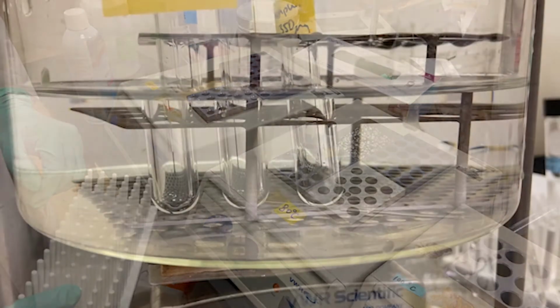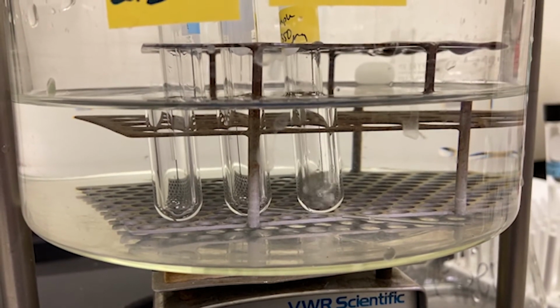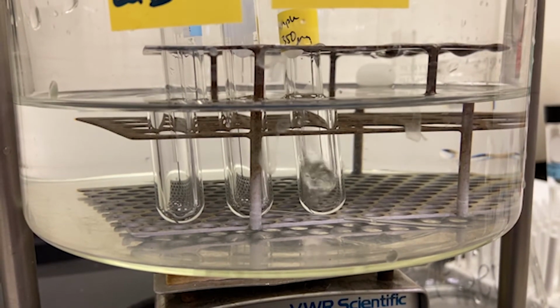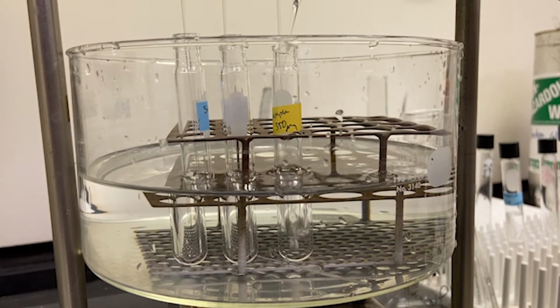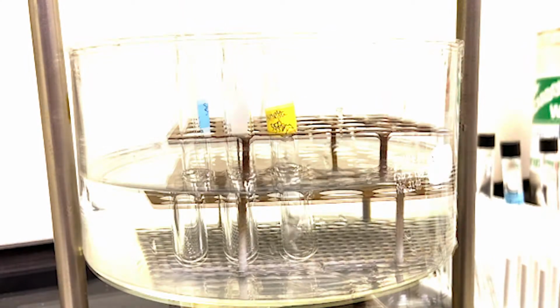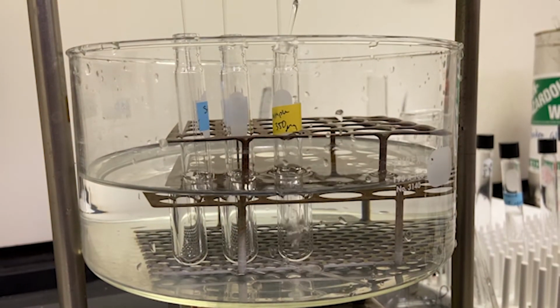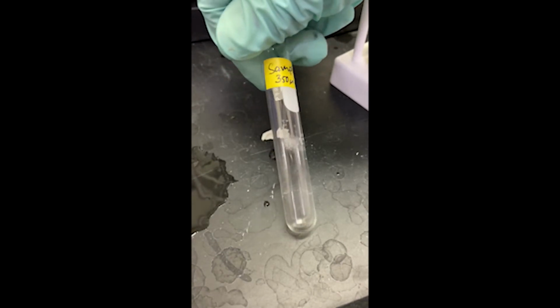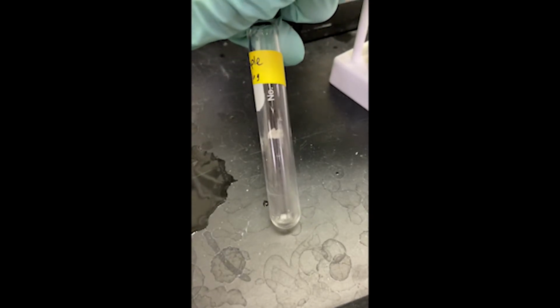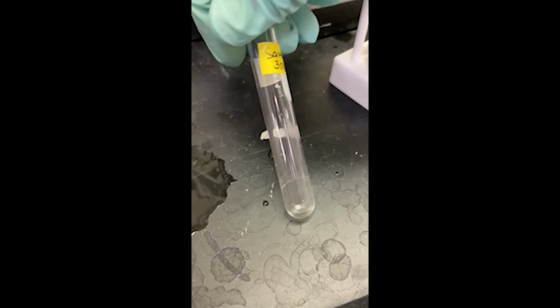After 16 to 18 hours on the heating block, the samples are dried under a nitrogen stream. 400 microliters of methanol is added 2 separate times and dried off to ensure that all the hydrogen chloride acid has been evaporated. Visually, the sample should appear to have a white residue dried on the edge of the tube walls to indicate that the hydrogen chloride has been evaporated.